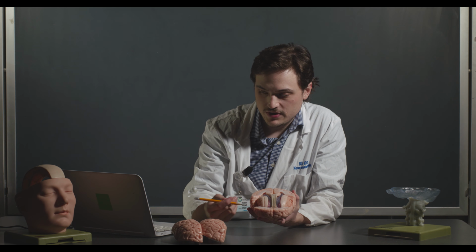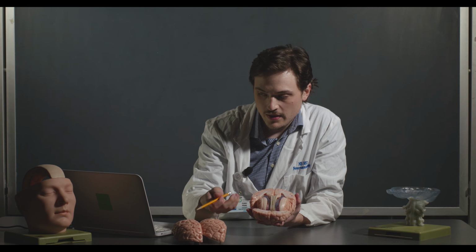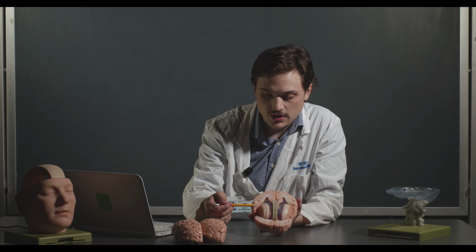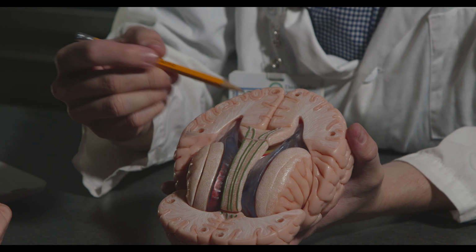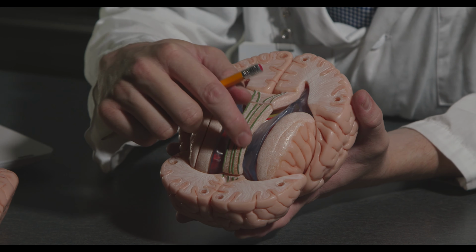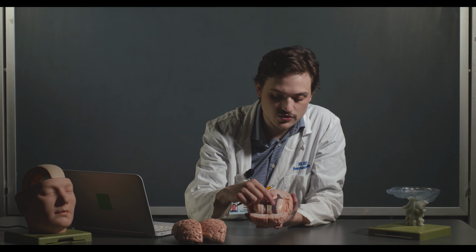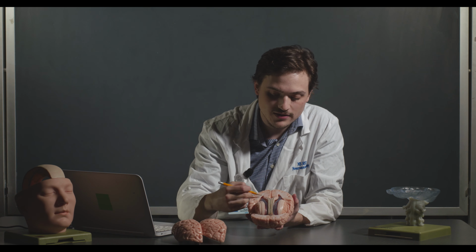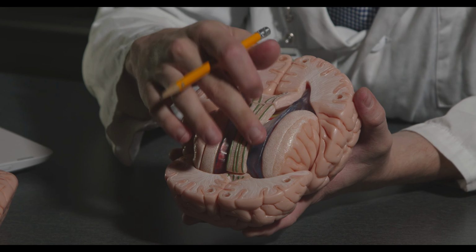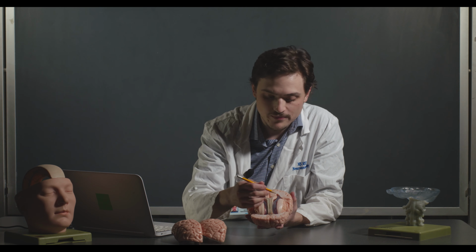Some other structures we're going to talk about a lot in subsequent labs and lecture, but just to highlight some of them, these again are in your lab manual, so you can refer back to it. We can see the insular cortex, which I named just a minute ago, and the lateral ventricles. Here they're shown as a model. Interestingly enough, you've probably heard about this in lecture, Da Vinci had some of the first drawings of the lateral ventricles because he took cadavers and put wax to fill in this cavity. This is here as a model, but it's actually a space that's filled with cerebrospinal fluid.